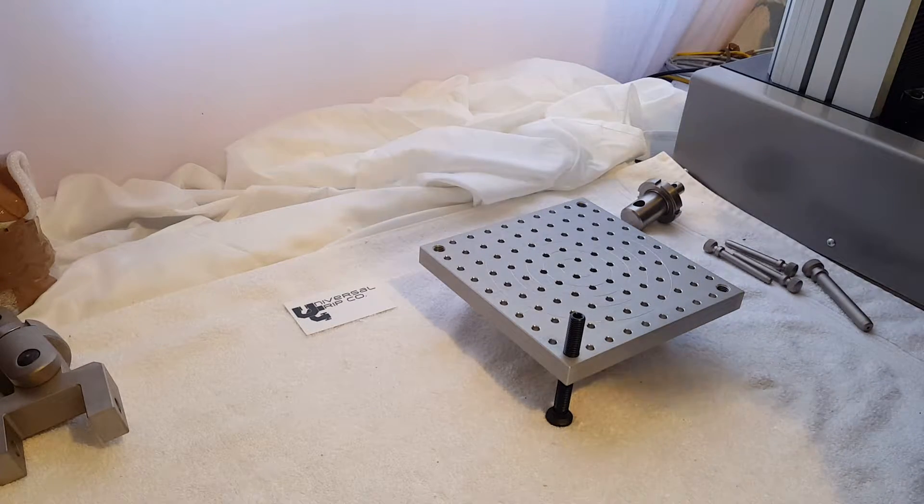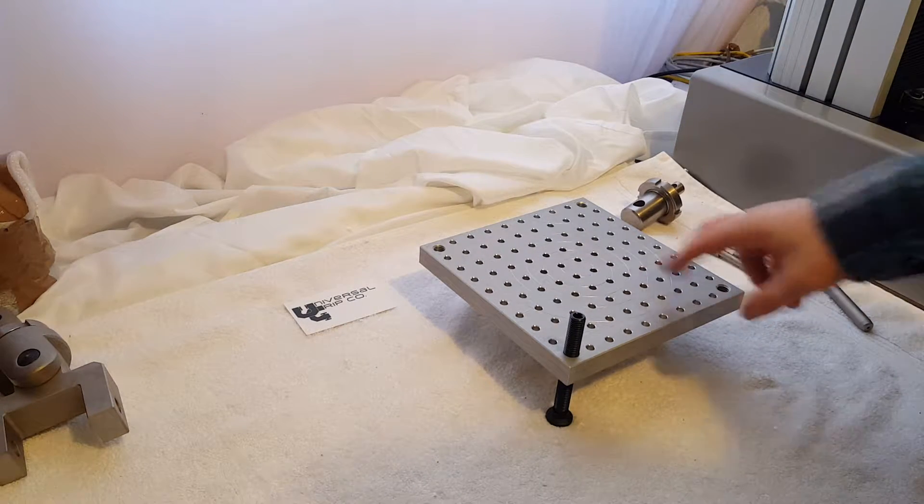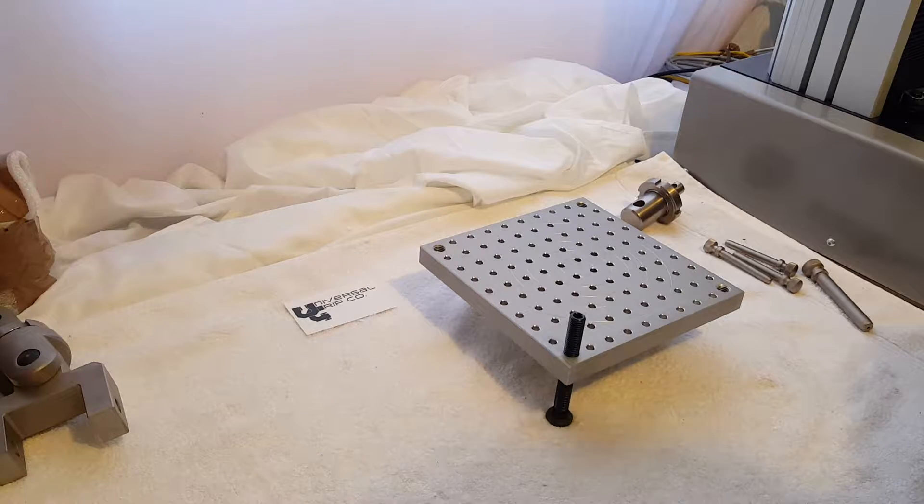Hello, today we are demonstrating the ASTM D3574 compression plate for foam testing.